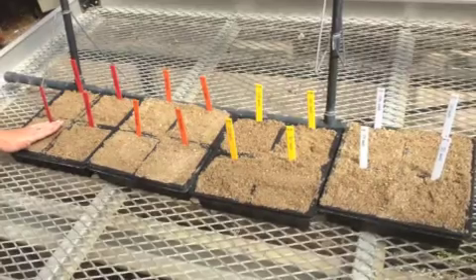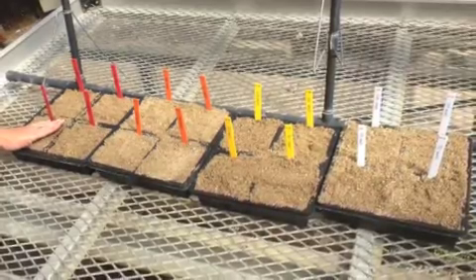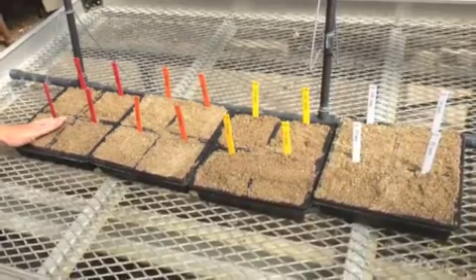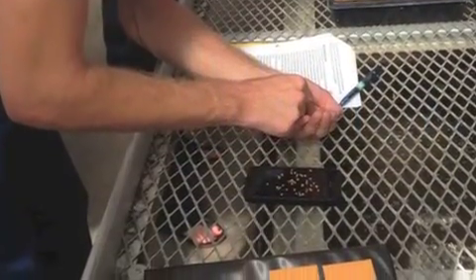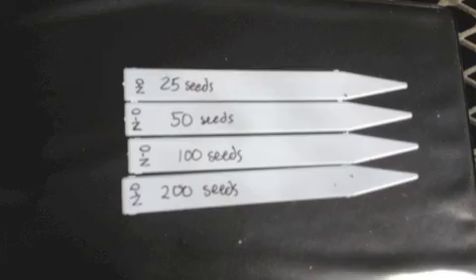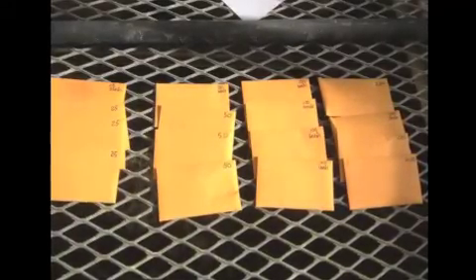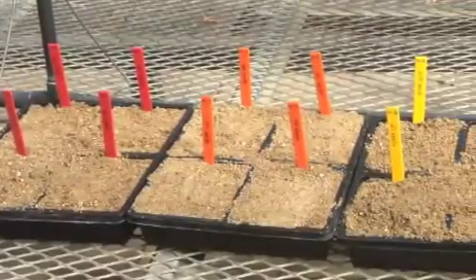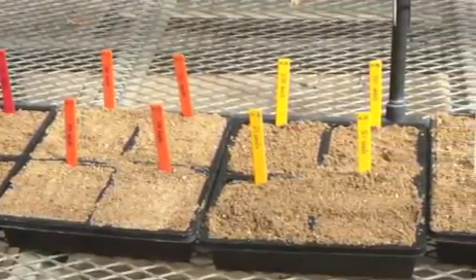Once the sand vermiculite mix is thoroughly mixed in with the ammonium nitrate, we topped off the soil and compacted each plot. Next, we prepared our seed. We needed quantities of 200, 100, 50, and 25 seeds for each tray. You will need 4 sets of these quantities. Apply the seed densities to the 4 pots in each of the 4 trays, labeling seed plots as you go.